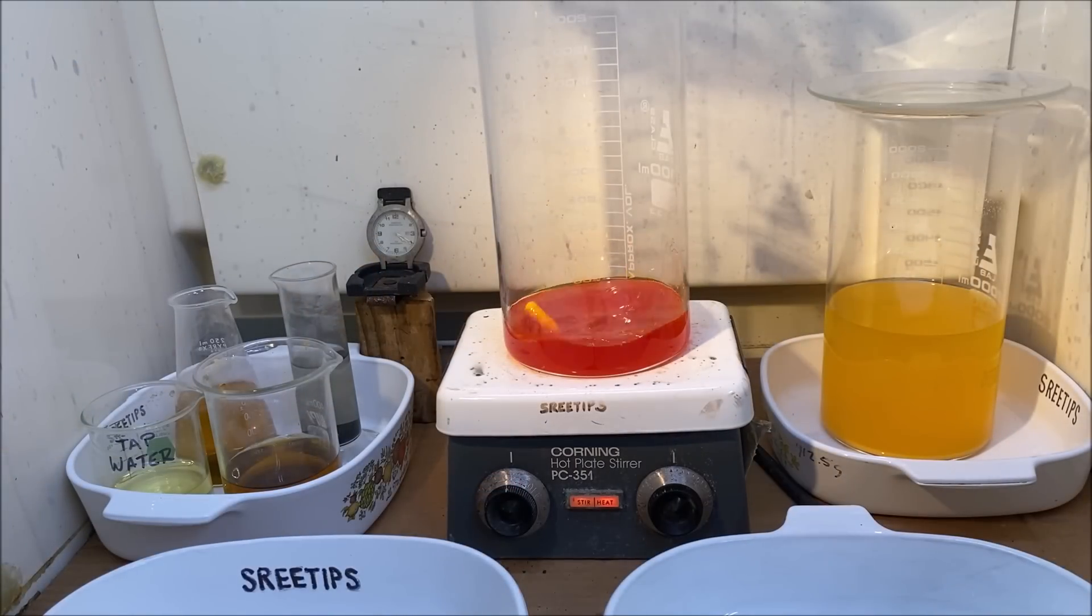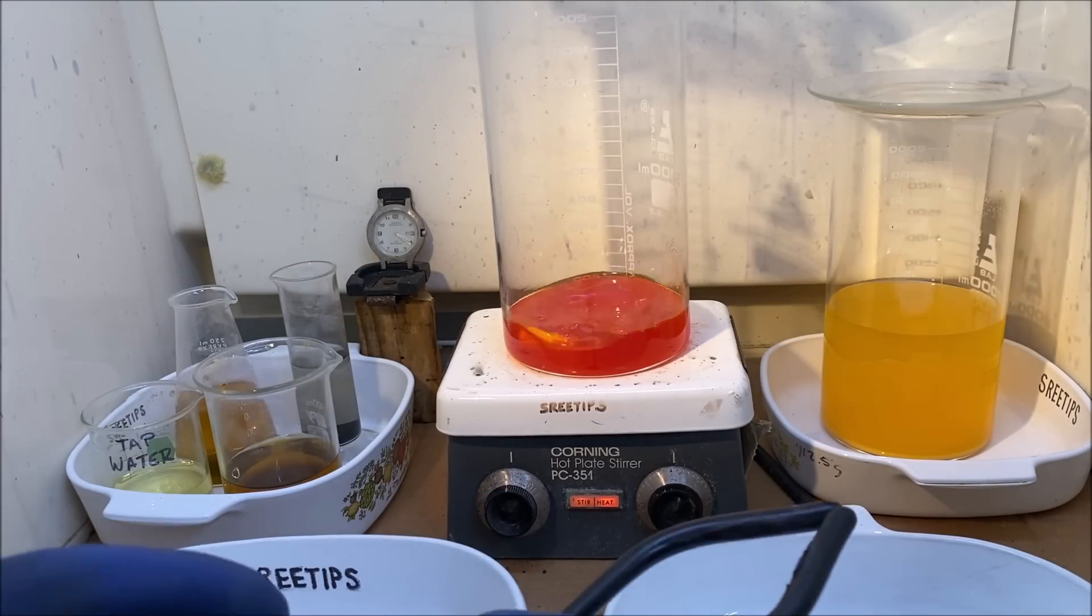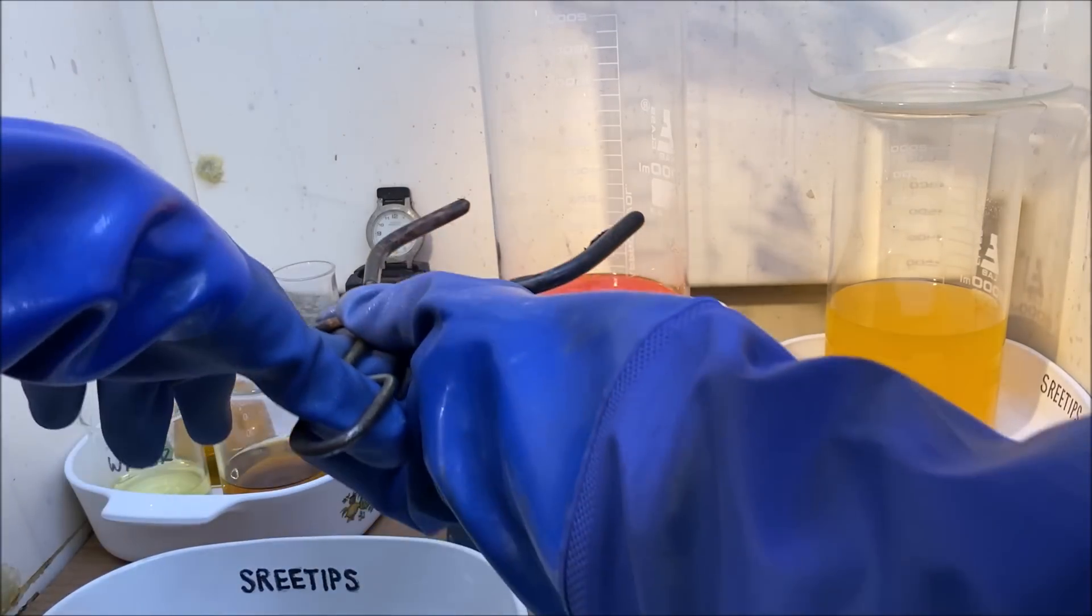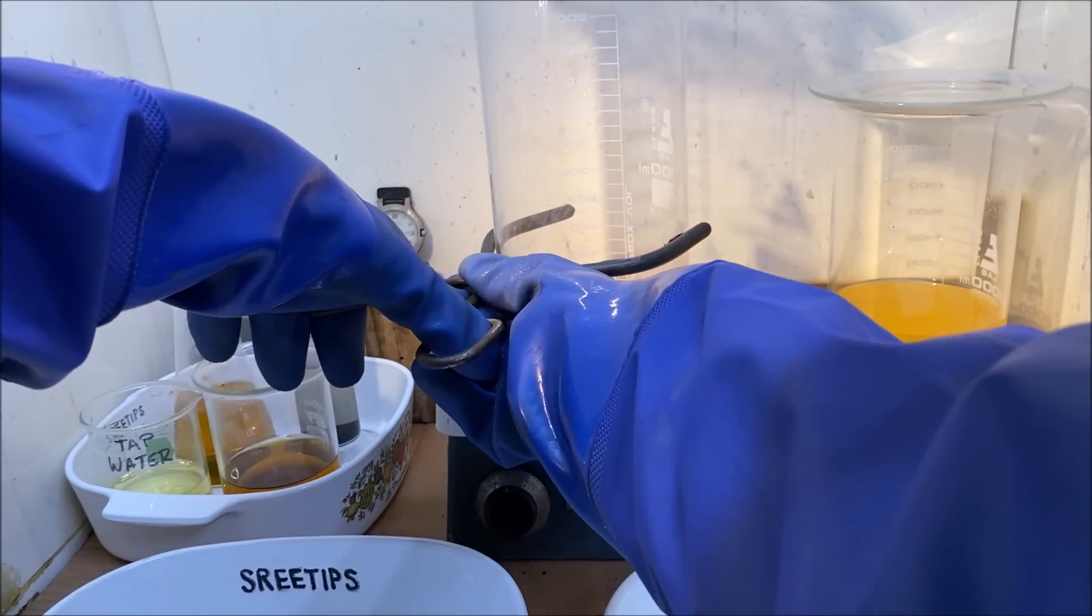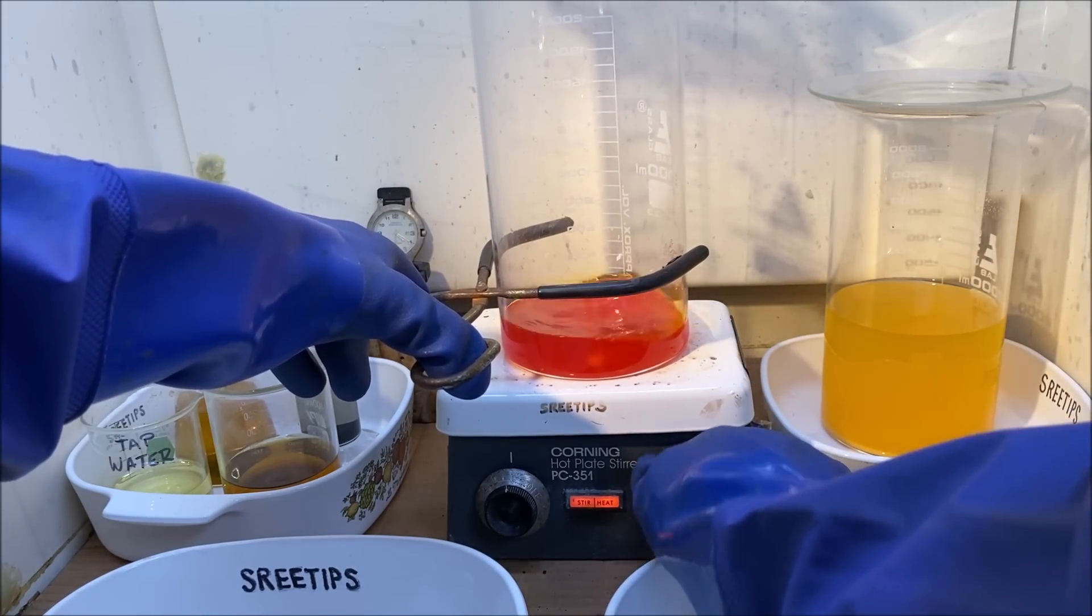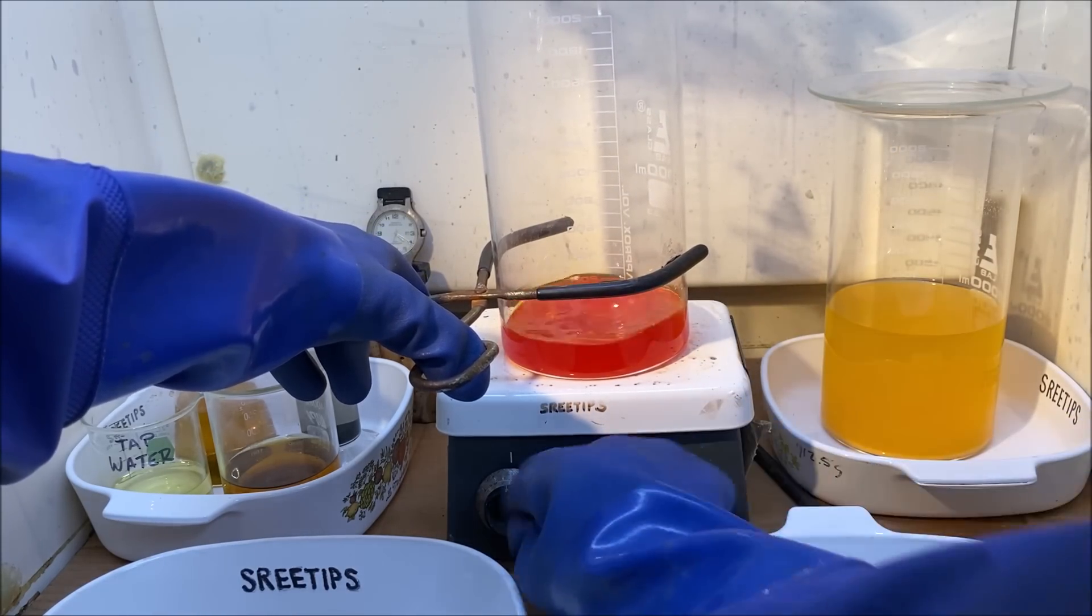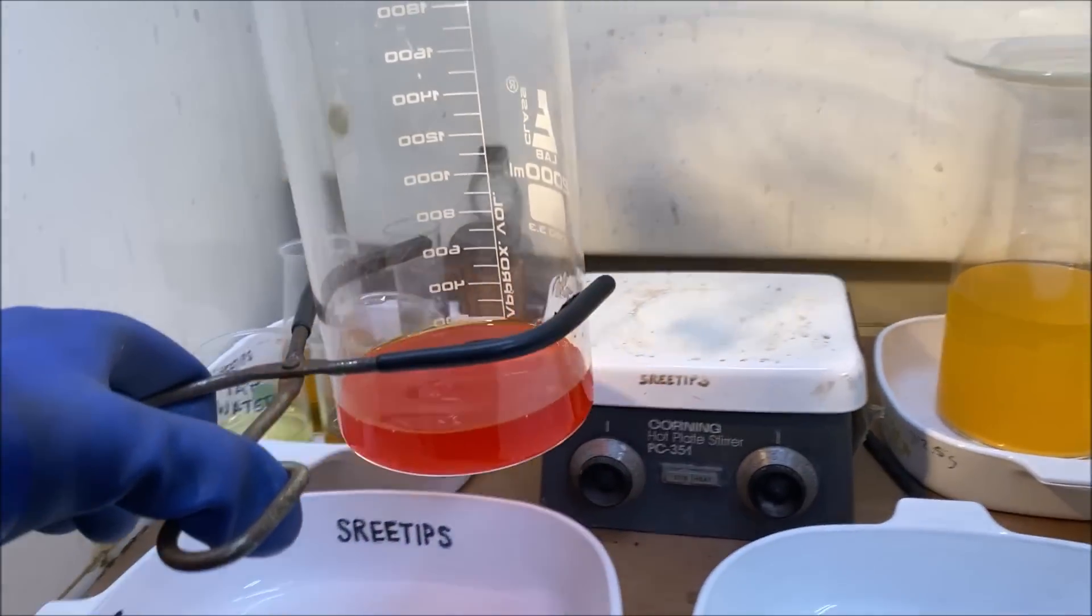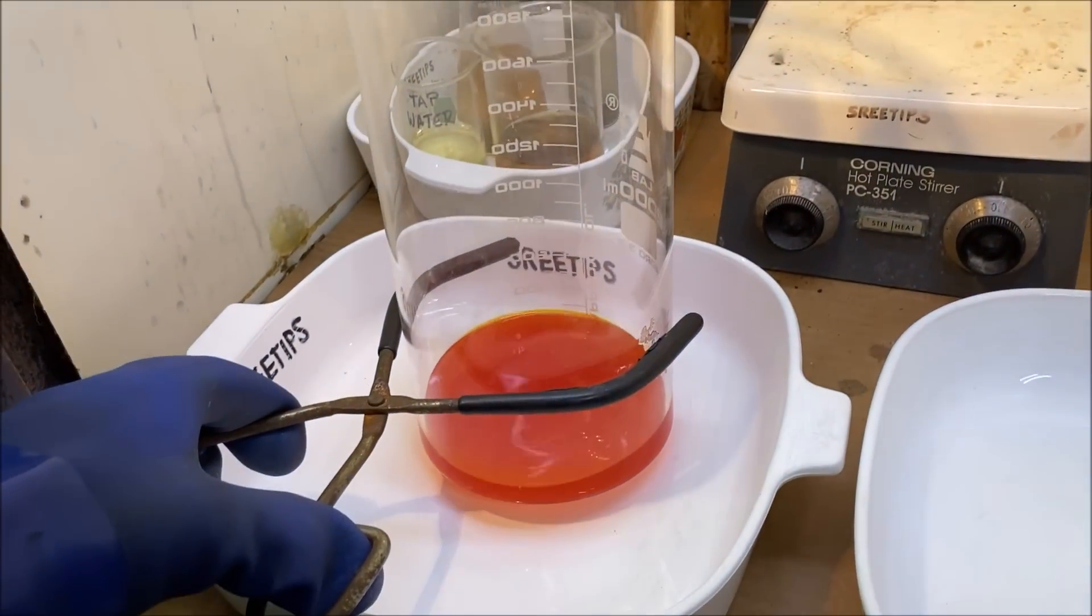I just checked the bottom of this beaker and all I could see was the remnants of the filter that was in there with this stuff. So I think we've got everything to dissolve. Turn the heat off and stick this down off the heat and let it cool down.